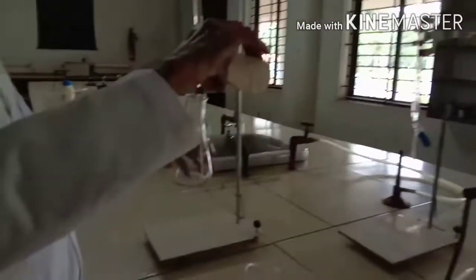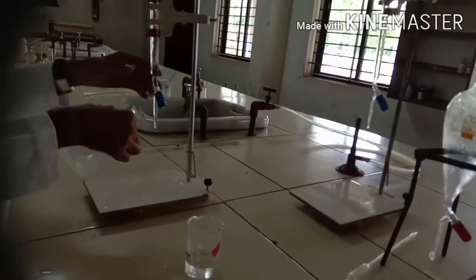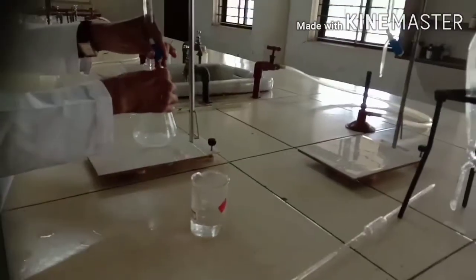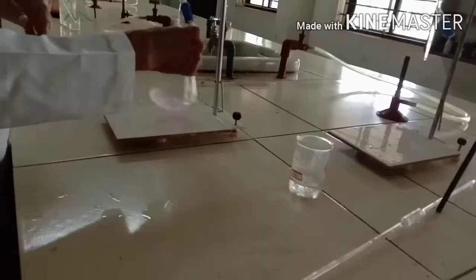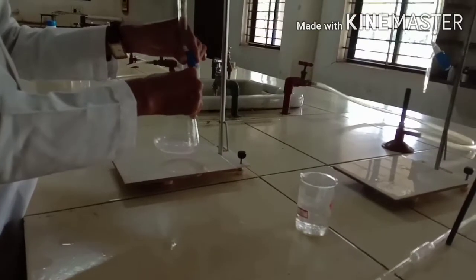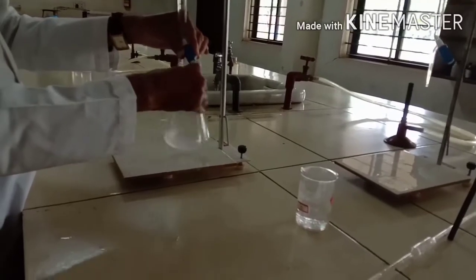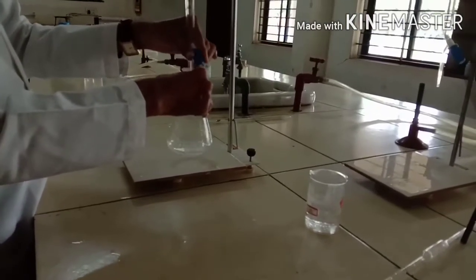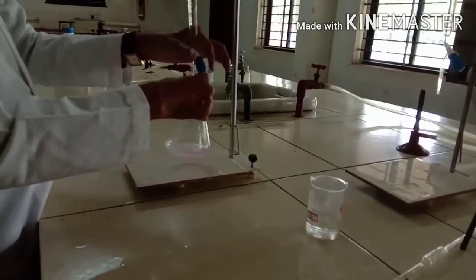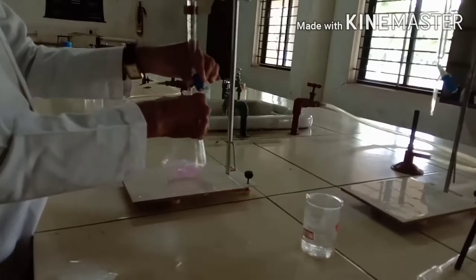Finally, calculate the concentration in the organic layer and in the aqueous layer, then apply the formula to find the partition coefficient of benzoic acid between benzene and water. The standard value is 25 at room temperature or at 25 degrees centigrade. The sodium hydroxide solutions used should be standardized using oxalic acid.